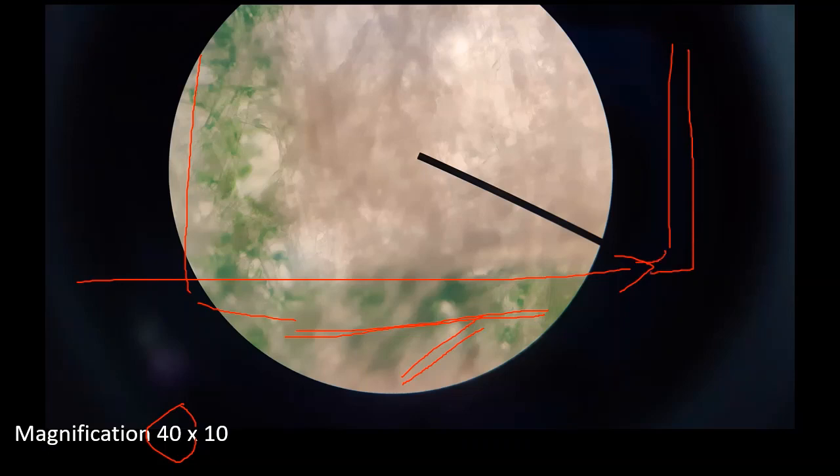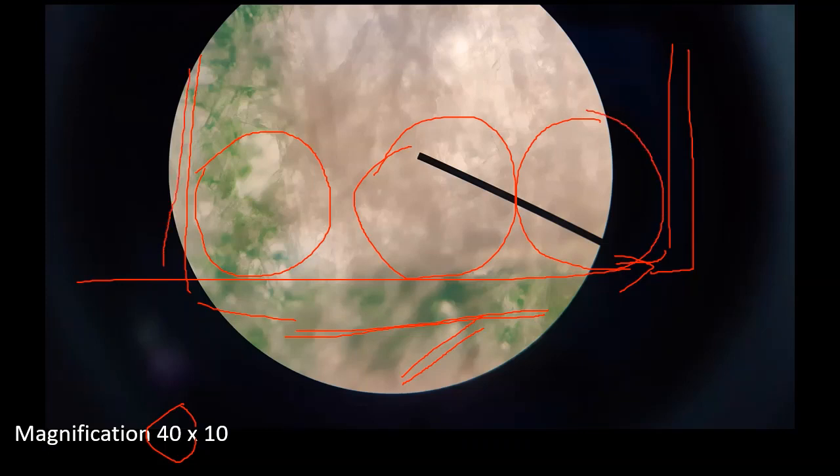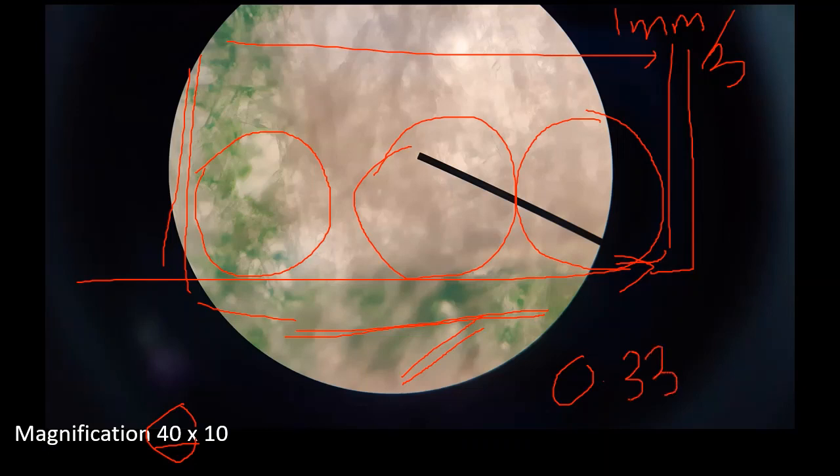So we have to count how many views we have. For example, under mine, we have 3 circles. We know that one smaller box here is equal to 1 mm. So I need to move 3 times, so 1 mm divided by 3. We know that one field of view under magnification 40 is around 0.33 mm.